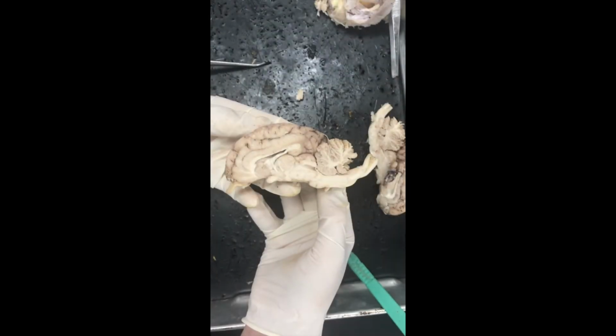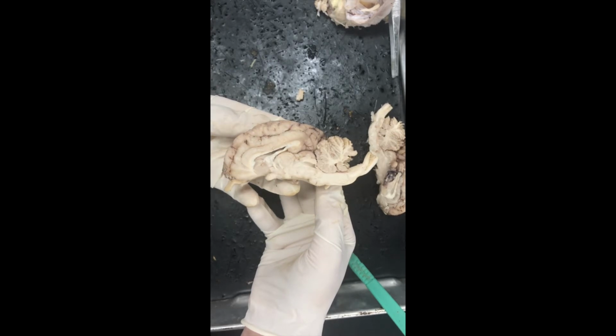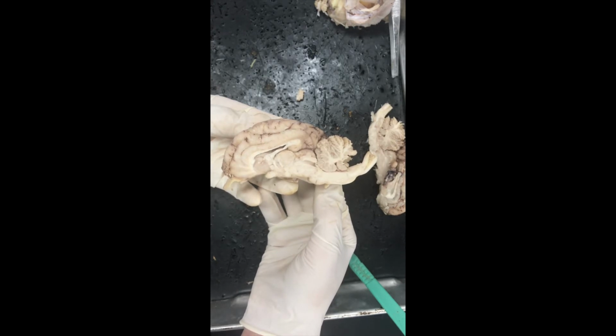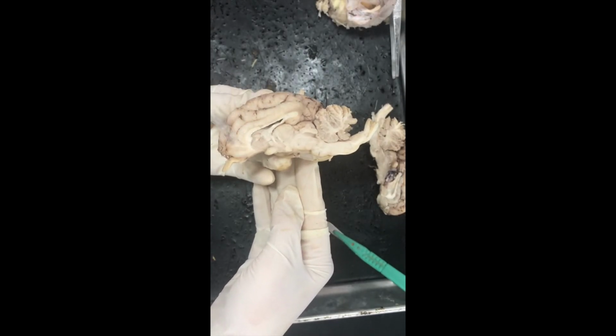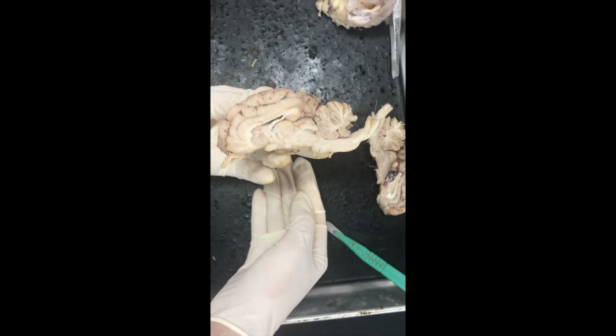Okay, so next we're going to point out the diencephalon, which is the inner brain. It consists of two parts, the thalamus and the hypothalamus. The thalamus controls sensation, pain, emotions, and arousal, and it acts as a relay center for senses. The hypothalamus controls heart, blood pressure, body temperature. So if you look here, you have sort of like almost a wrench shape, and that's known as the corpus callosum, and that just holds the two hemispheres together.